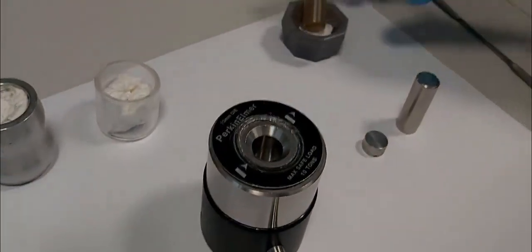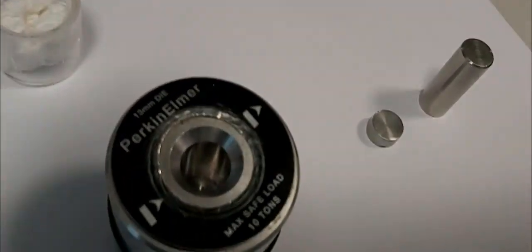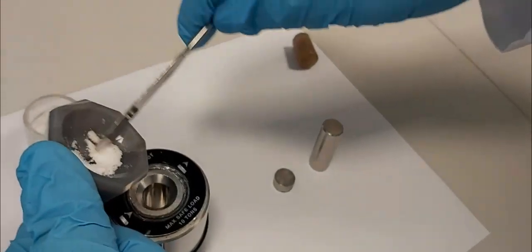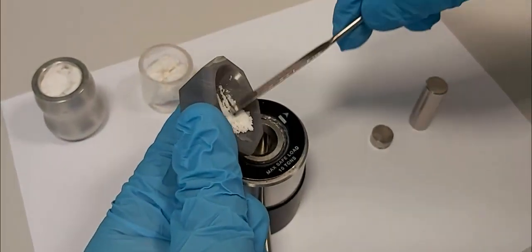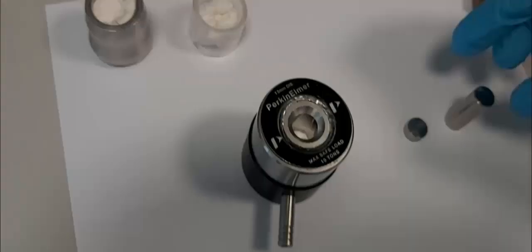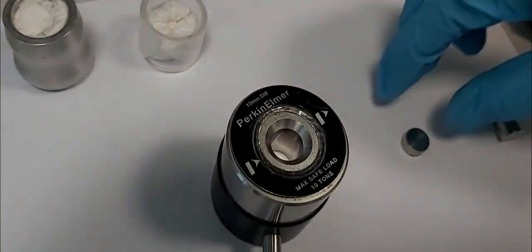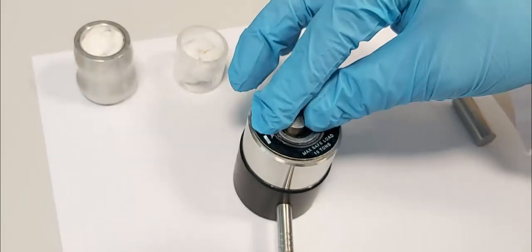Then we place this powder in the metal press die, sandwiched between two metal bolts — one down, then we put the sample powder, then the other one on top. We have here only the KBr alone powdered. We place the powder, then use the small metal piece to distribute the solid evenly.